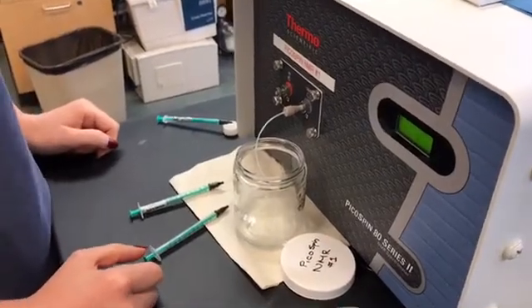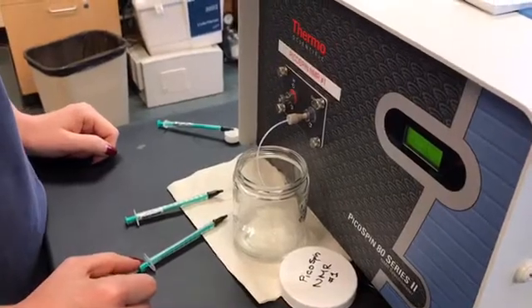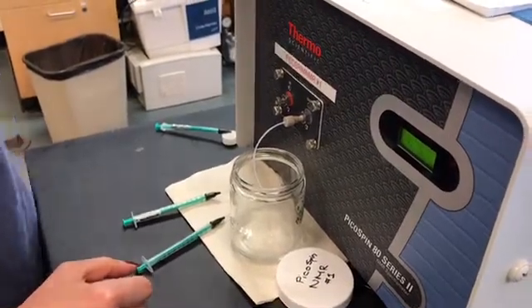In order to prepare the NMR for your sample, we're first going to inject it with air, followed by flushing with acetone, and then injecting it with air again.